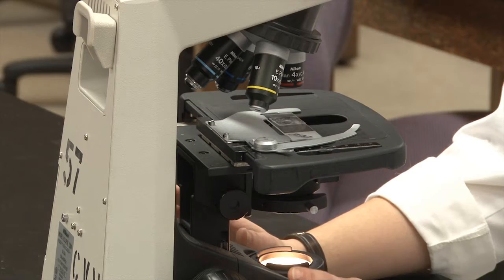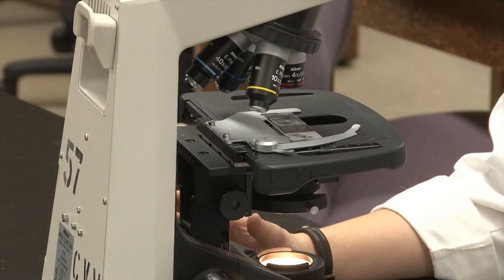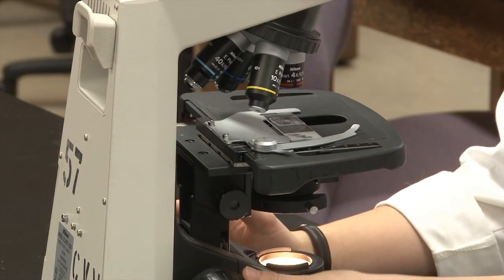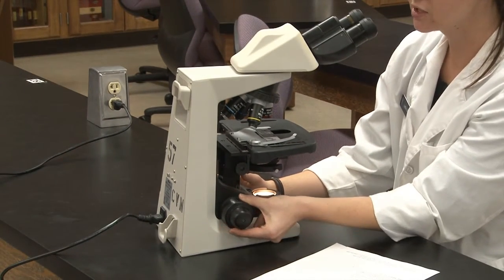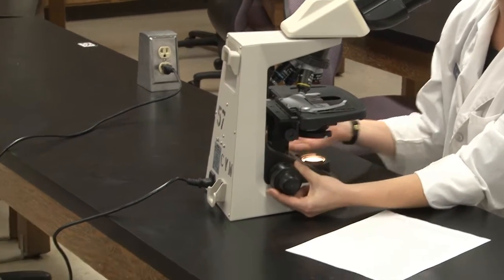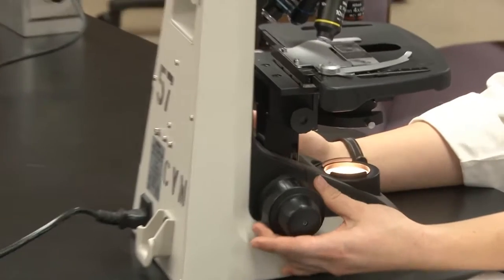Now that our slide is on the stage and centered, you need to focus it. When you're on your 4x objective you can use the big knob called the coarse adjustment. It's called coarse because it's very rough — it moves the slide stage up and down by a lot.